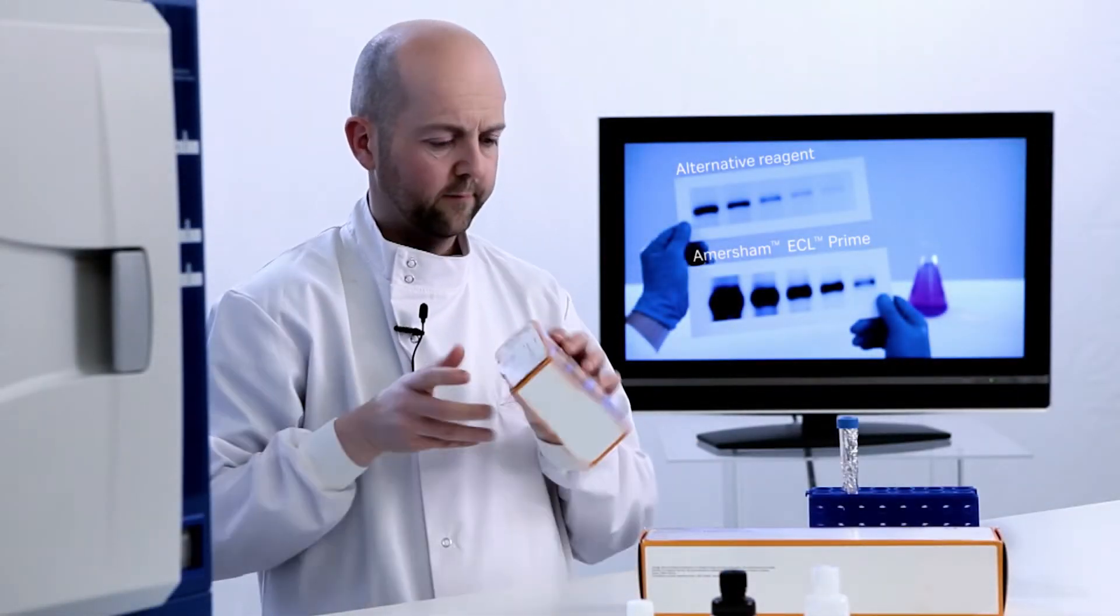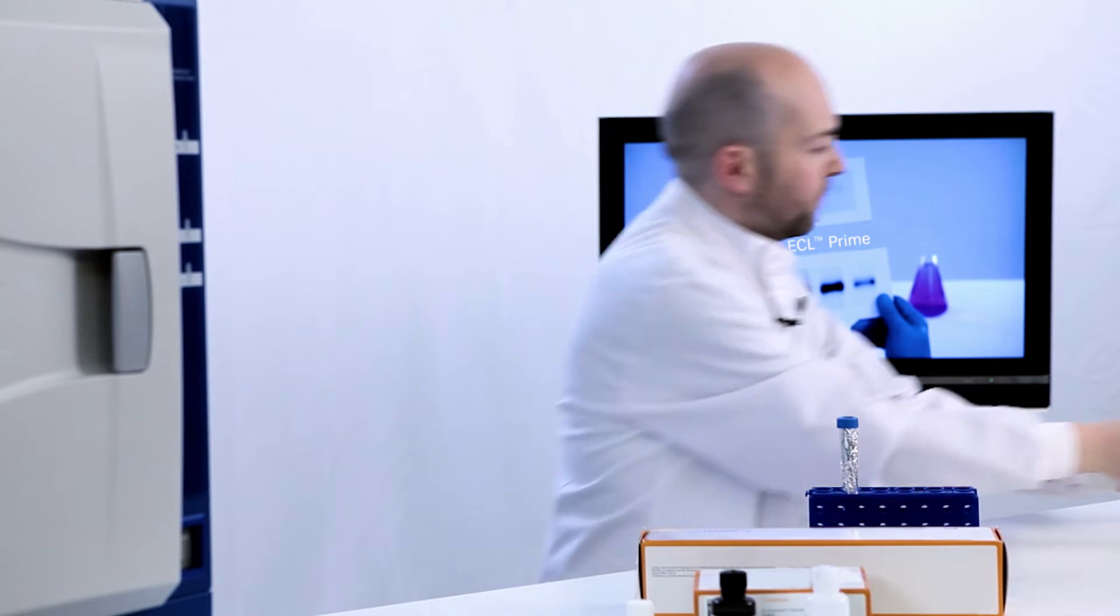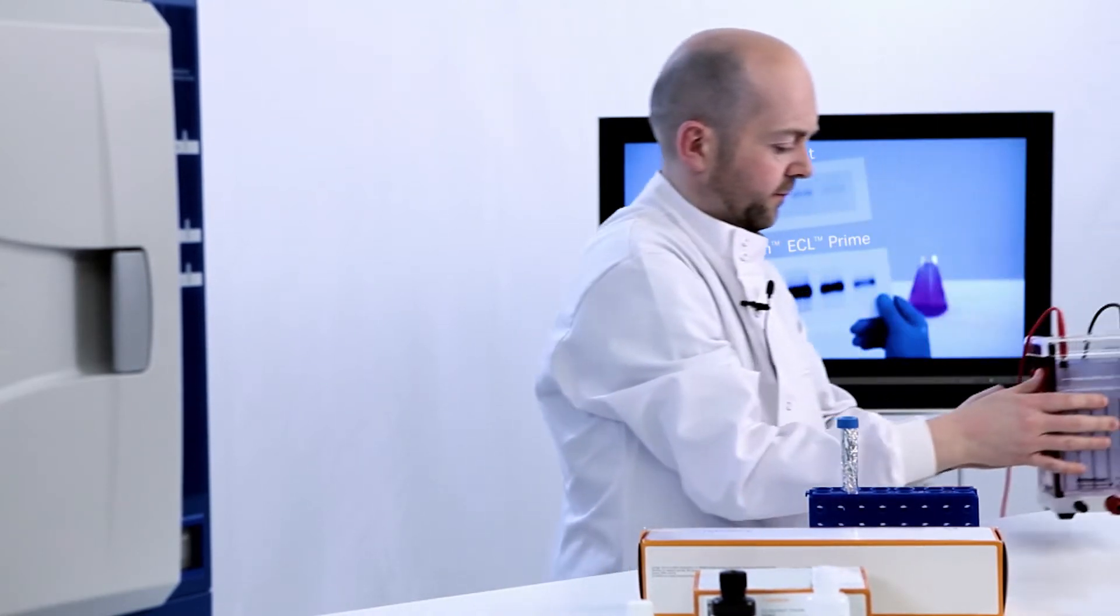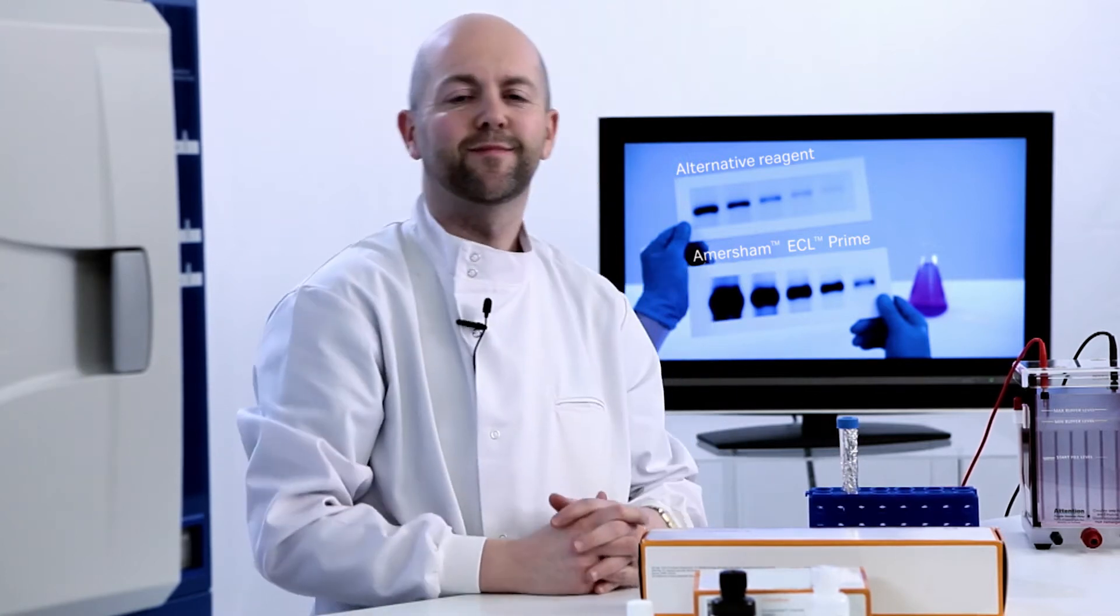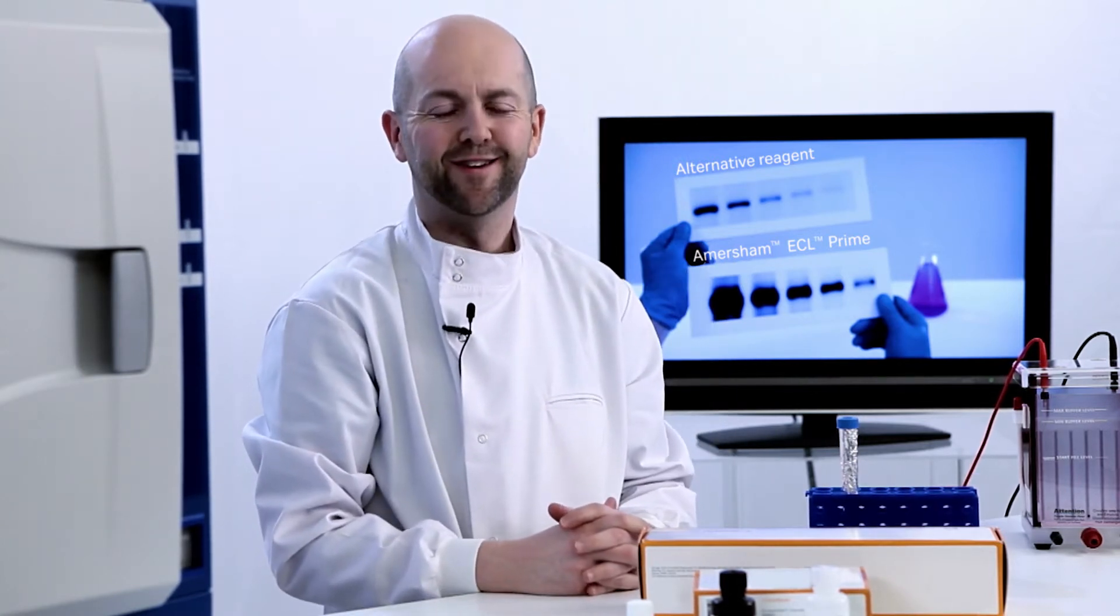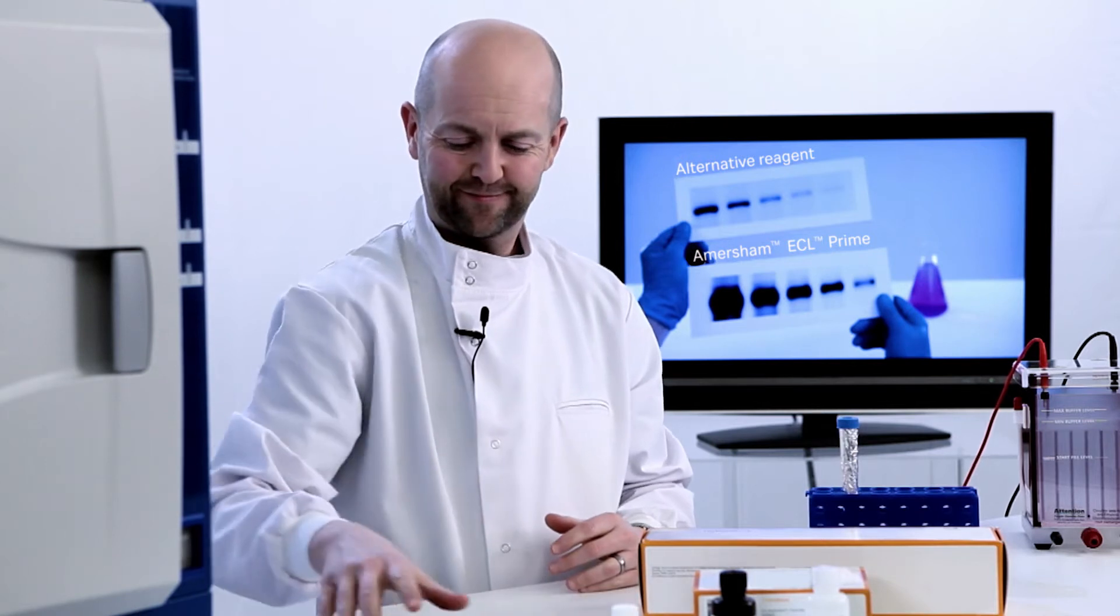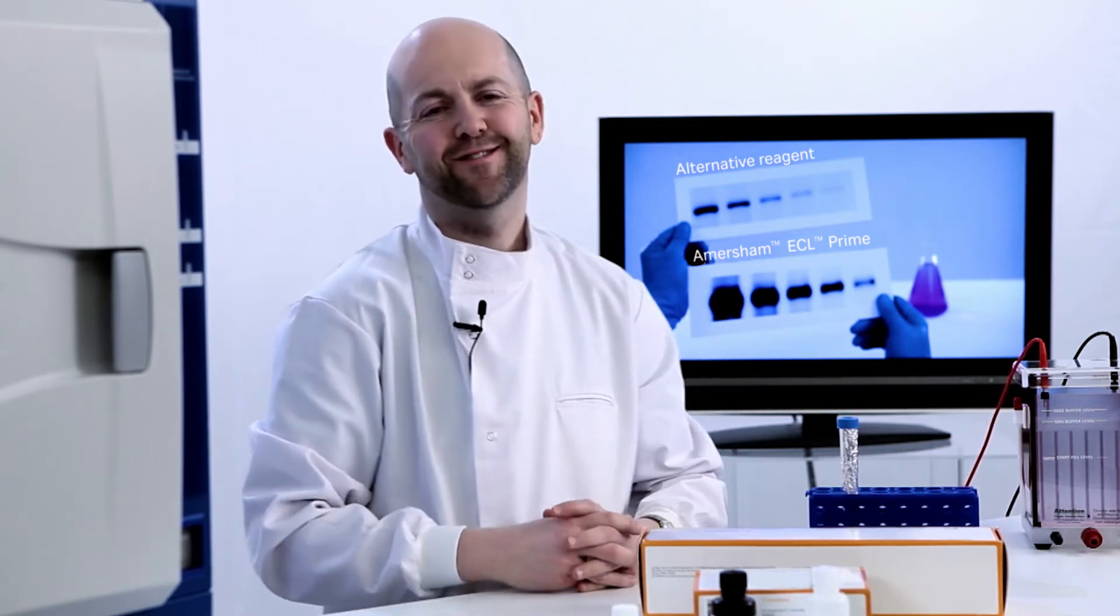This step-by-step Western blotting video will show you how to get better results by doing exactly what you do today by using the ECL prime blotting reagent. Mike will take you step-by-step through Western blotting, giving you all the tips and tricks you need to get the best from Amersham ECL prime.